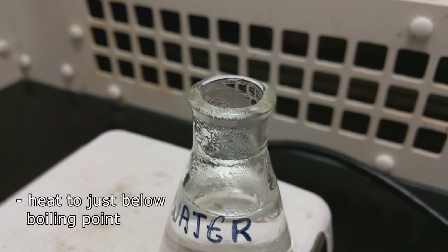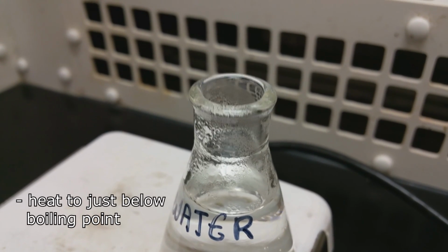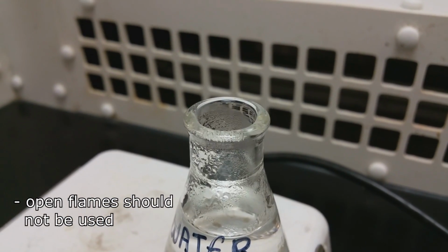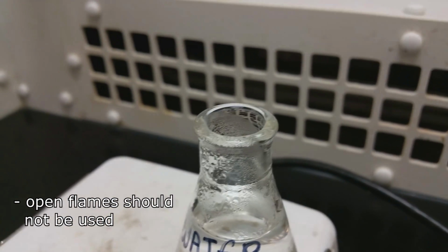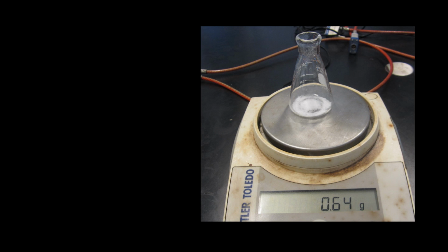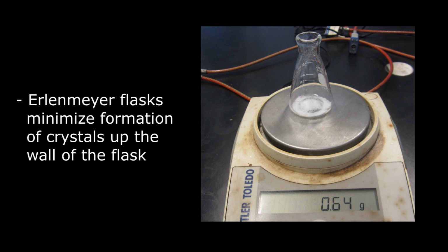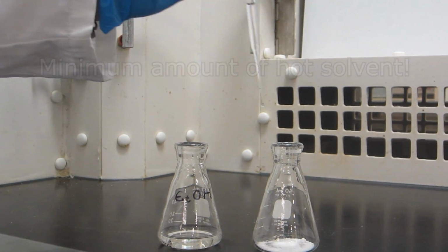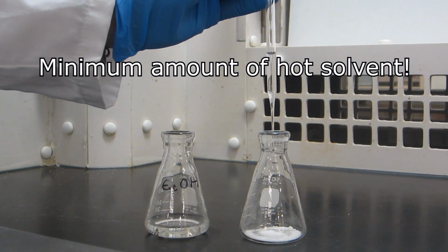Heat the solvent gently on a hot plate to just below the boiling point of the solvent. Note that organic solvents are flammable, so open flames should not be used. Place about 0.6 to 0.7 grams of the impure compound in another Erlenmeyer flask. It is important that an Erlenmeyer is used instead of a beaker, as it will minimize the formation of crystals up the wall of the flask. Recrystallization involves dissolving the sample in a minimum amount of hot solvent.